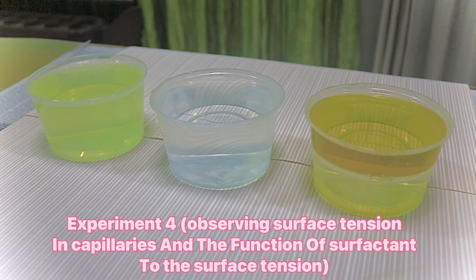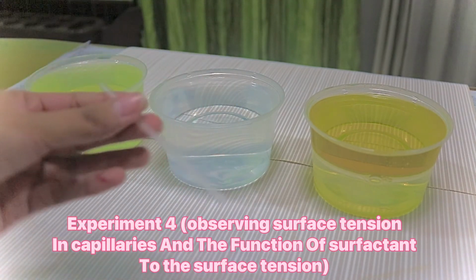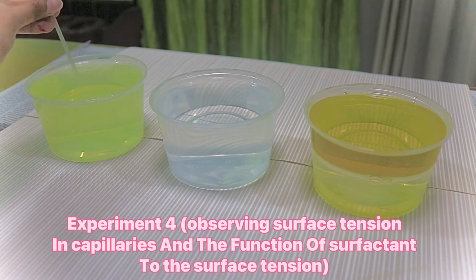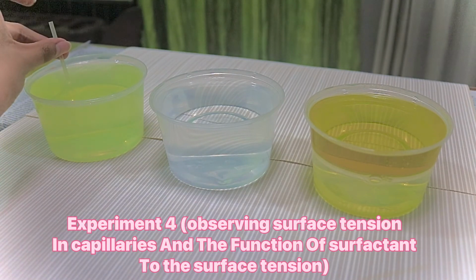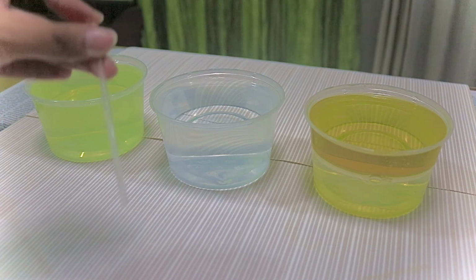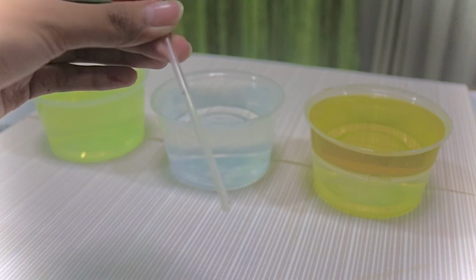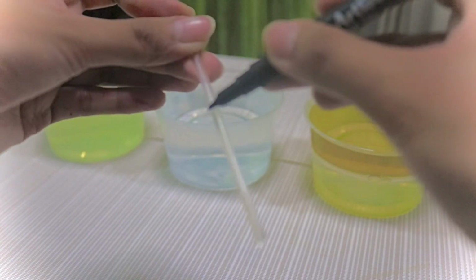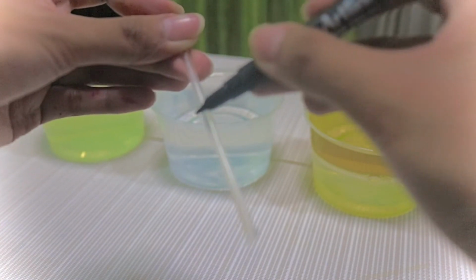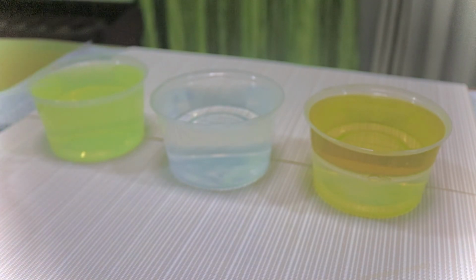The last experiment is to observe surface tension in capillaries and the function of surfactant on surface tension. First, I place the straw perpendicular to the surface of water with soap, and I allow the liquid to rise up through the straw. And then I mark the level of the liquid in the straw.